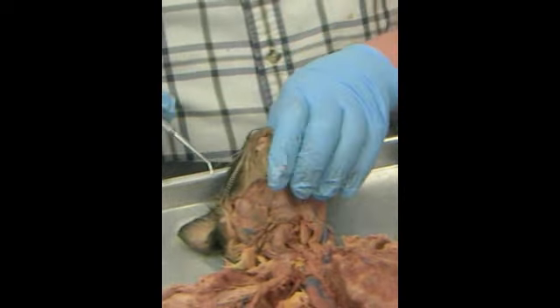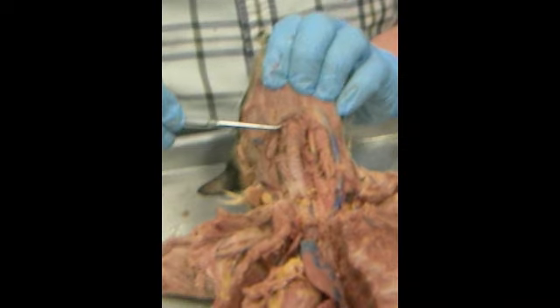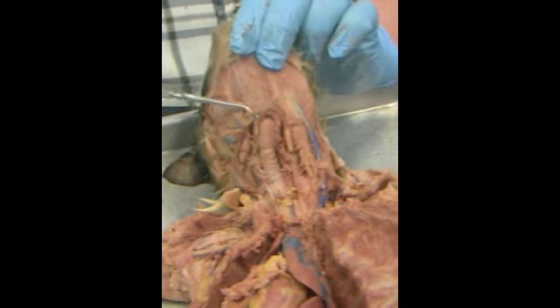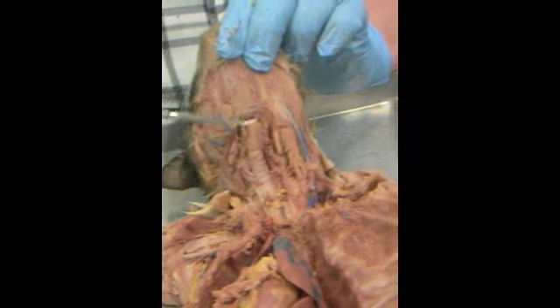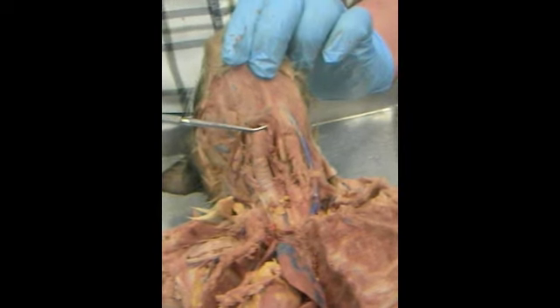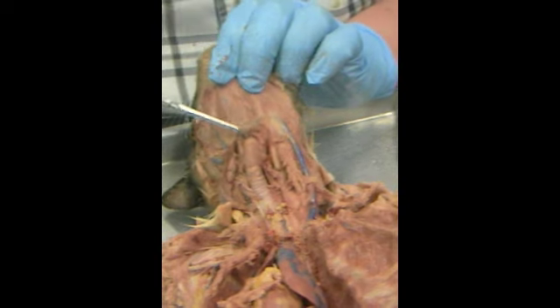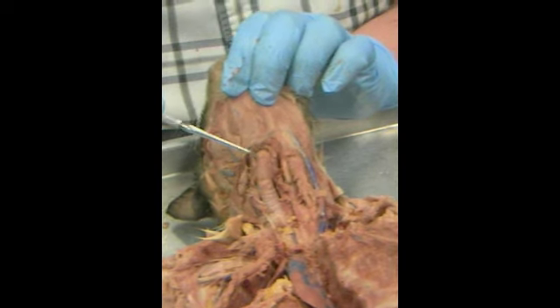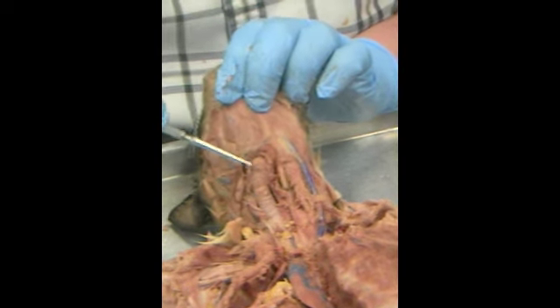We're now outside the cat's face. We're coming down the throat. One of our landmarks here is the transverse jugular. Once we get past the transverse jugular, right in here is the larynx, or voice box. This shiny piece right there is the thyroid cartilage. Below that is a piece covered with more muscle.